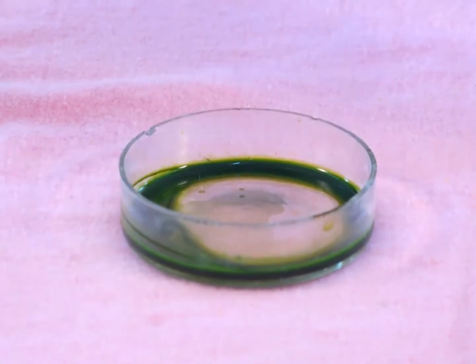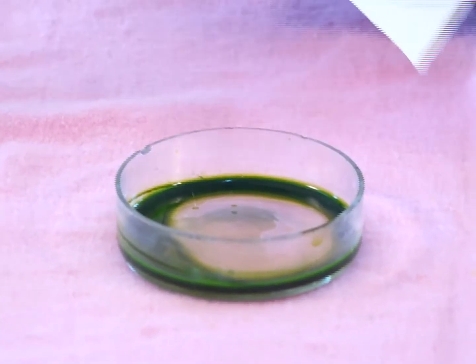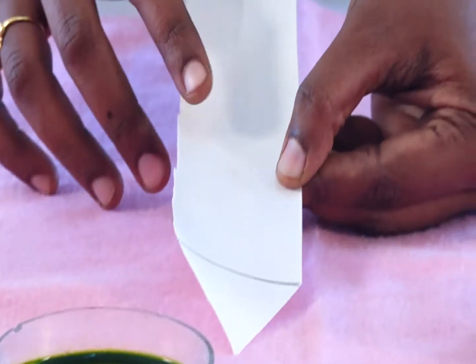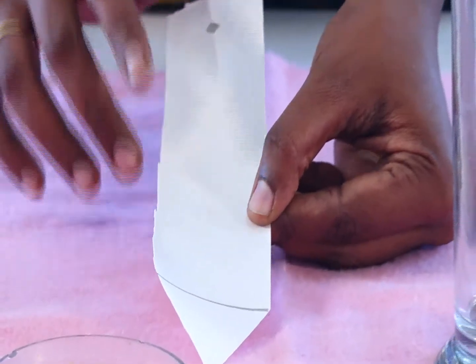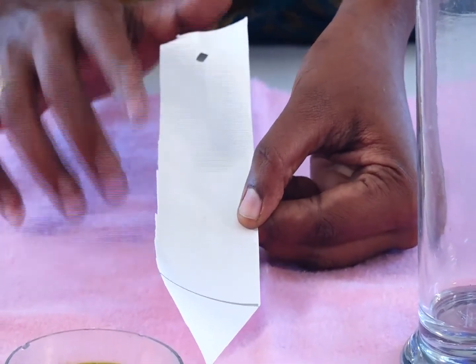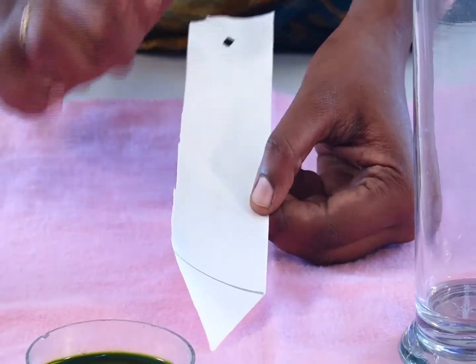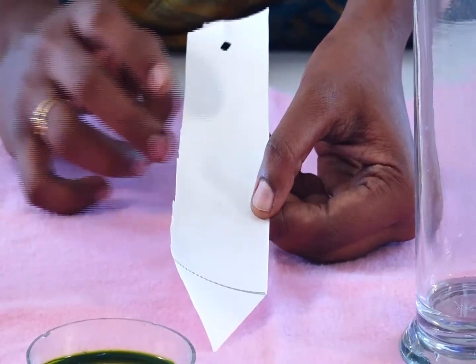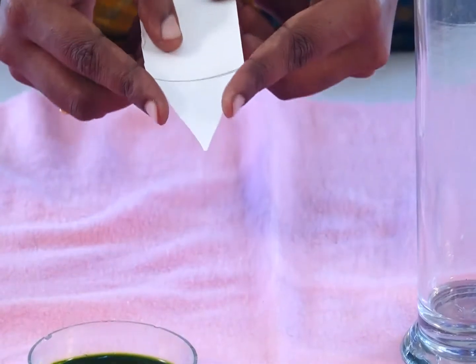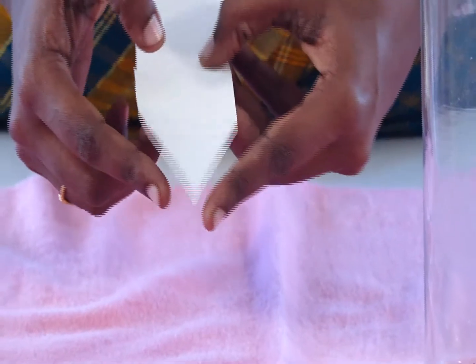For the next step, we take one piece of Whatman number 1 paper. We have to cut one edge of this paper into a V-shape and set it ready.